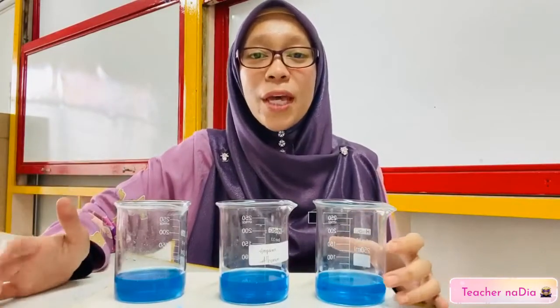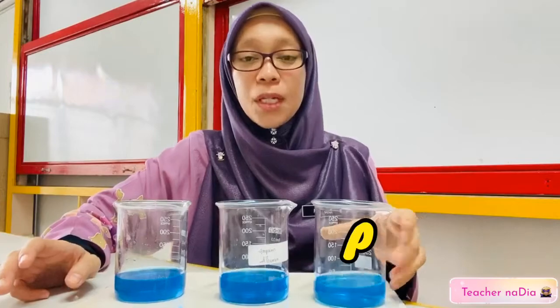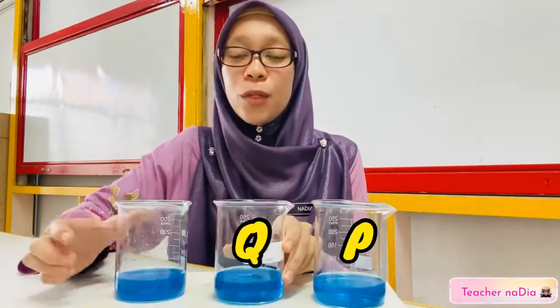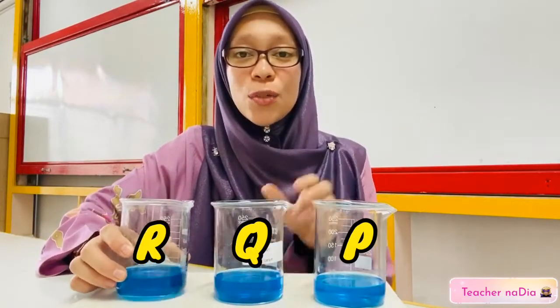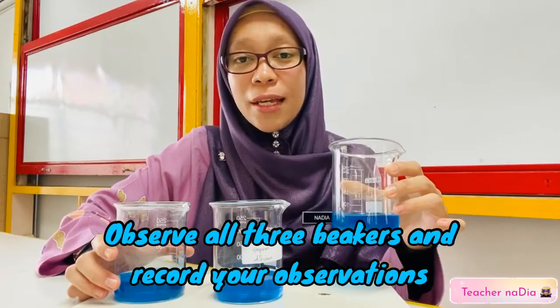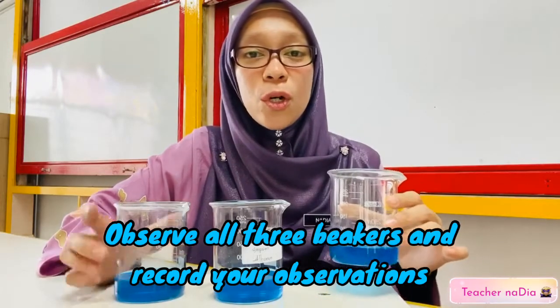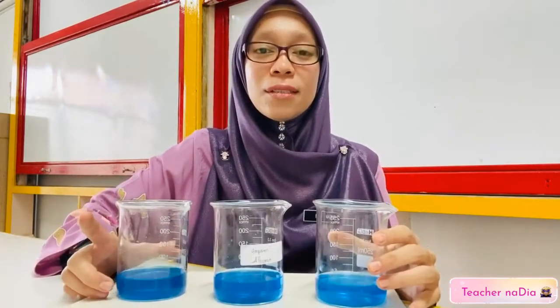Now we have prepared 3 beakers. The first one is P, beaker Q, and also beaker R. So now let's observe the color of the solution and record all your observations. Make sure you record all your observations in the table.